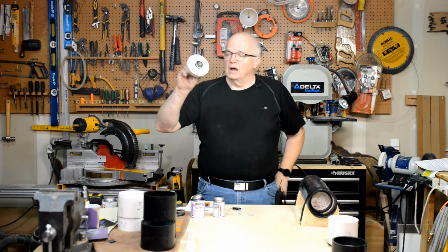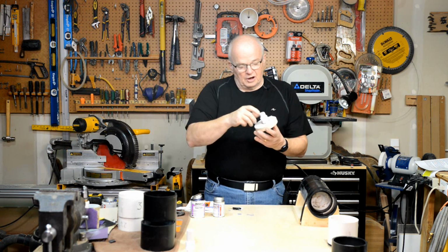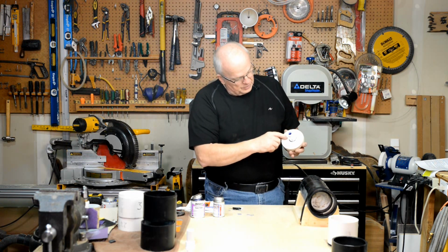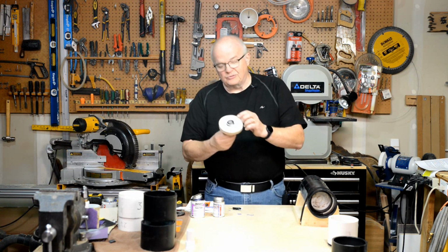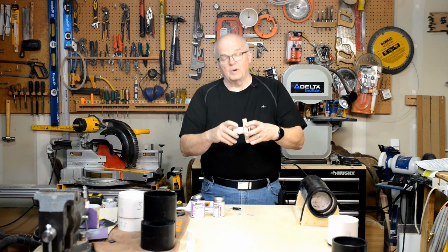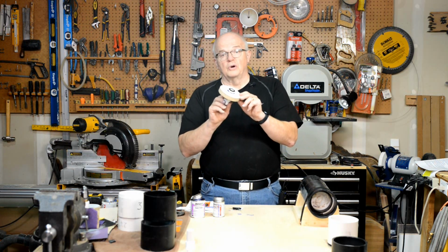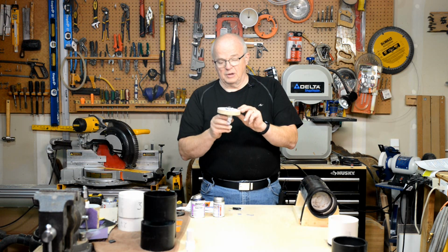Okay, you have this piece epoxied into there. There's a nice layer of epoxy that's squeezing out down around this base. This ring is keeping that thing tight in there. There's epoxy all the way throughout it, and you've got a good seal there. So go ahead, and we're going to pause there.